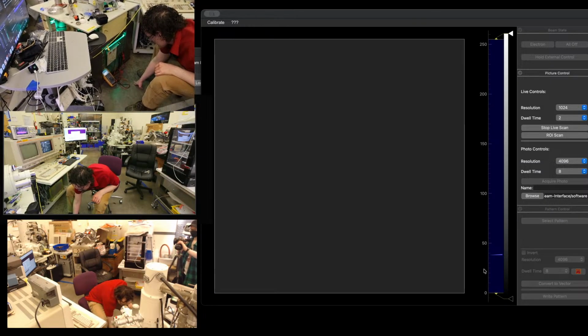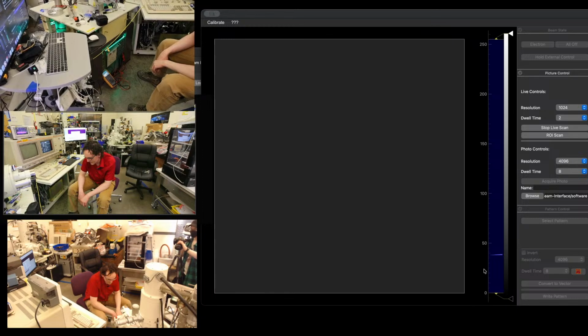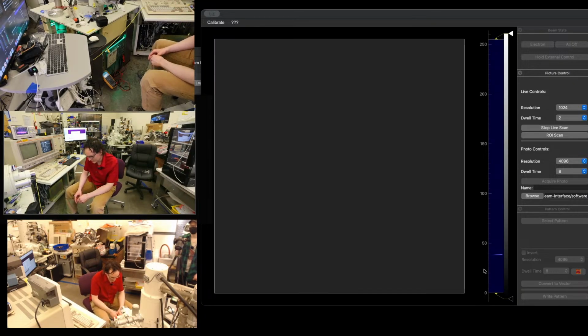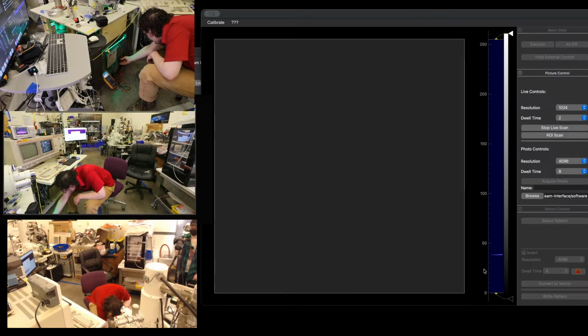Oh, it just went up. And it's still going up. Are you in current or voltage? I'm reading voltage right now. It seemed like when I touched the probe one time, it cycled the valve. I was like, that's weird. So we're at 0.156 volts. 0.157. So we are going up slightly. Let's check PG1. PG1 will be more sensitive to a load lock issue.